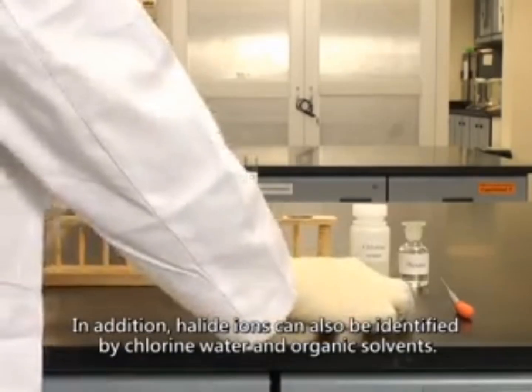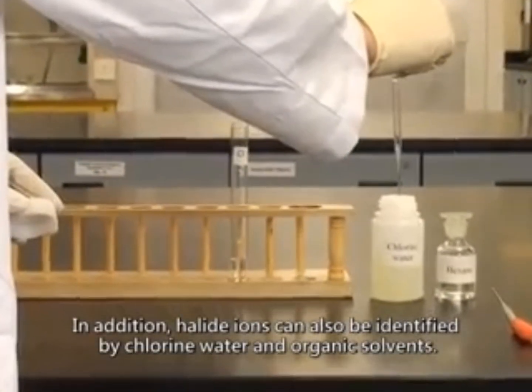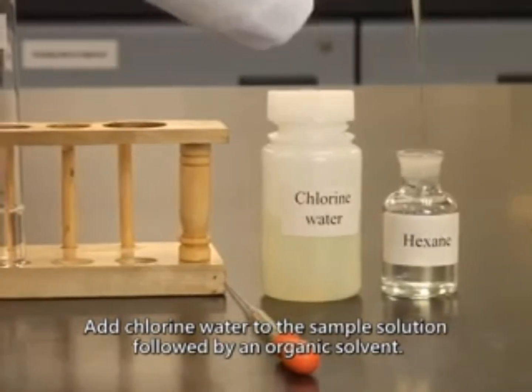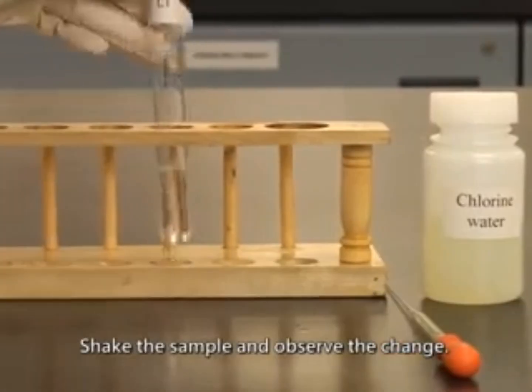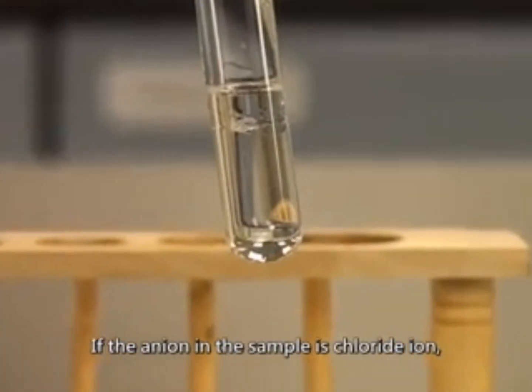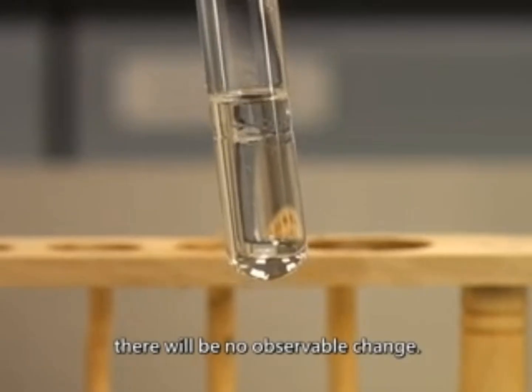In addition, halide ions can also be identified by chlorine water and organic solvents. Add chlorine water to the sample solution, followed by an organic solvent. Shake the sample and observe the change. If the anion in the sample is chloride ion, there will be no observable change.